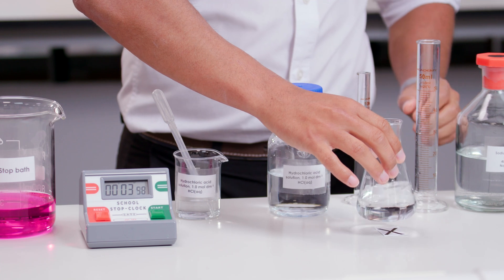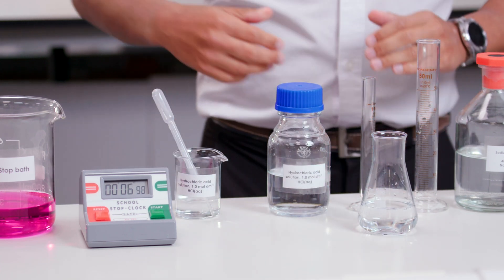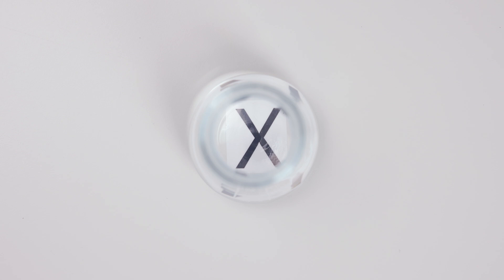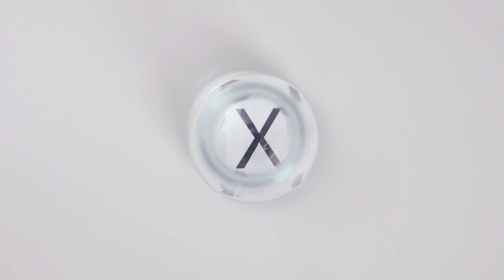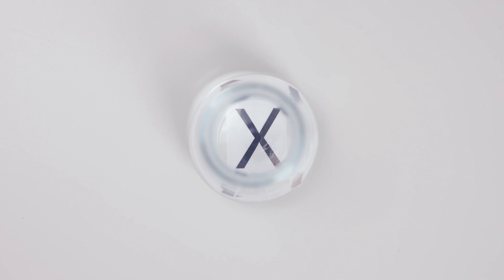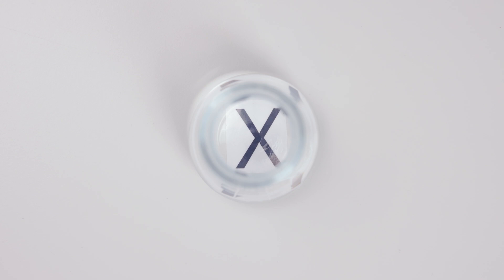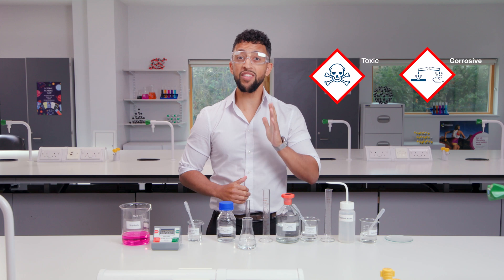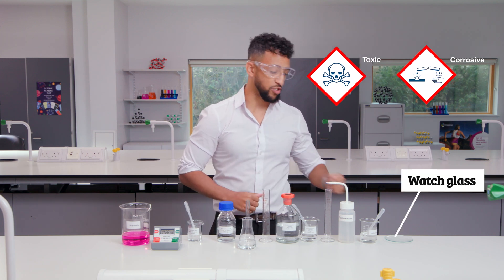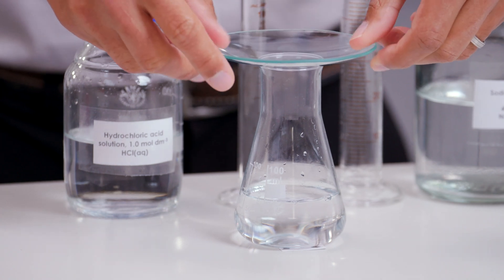I'm then going to give the reactants a swirl. Time how long it takes until you can no longer see the cross — look at it from the same distance, at least 20 centimeters above, each time. Take care not to breathe in any of the toxic sulfur dioxide fumes. Limit the amount of sulfur dioxide gas released into the classroom by placing a watch glass on top of the conical flask.